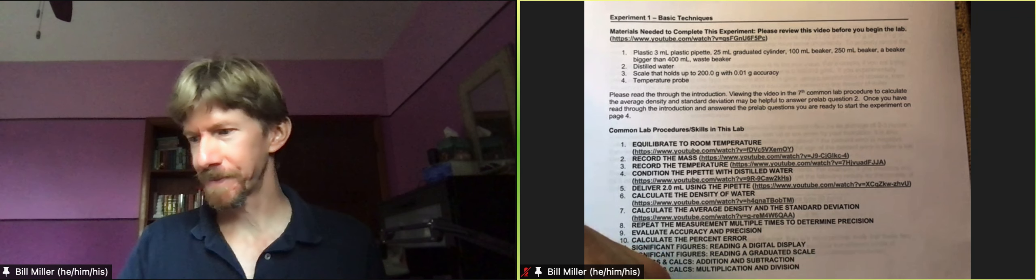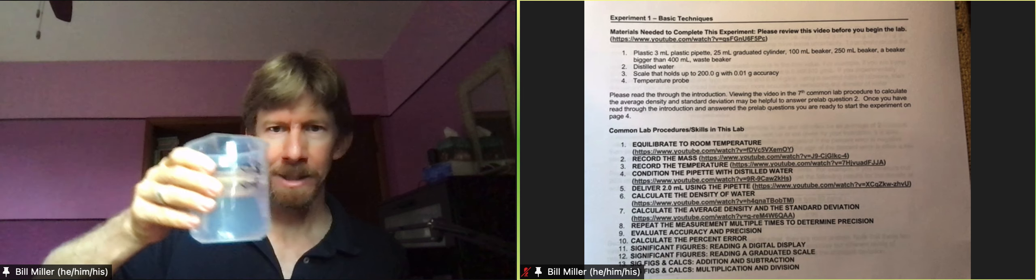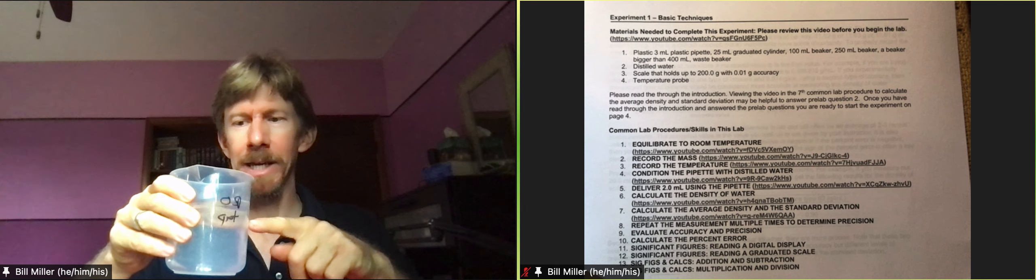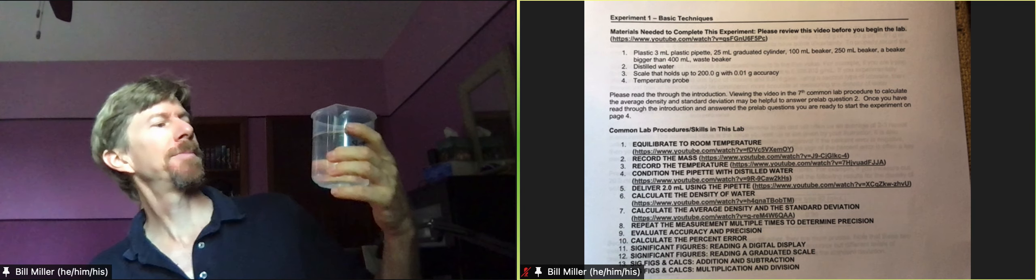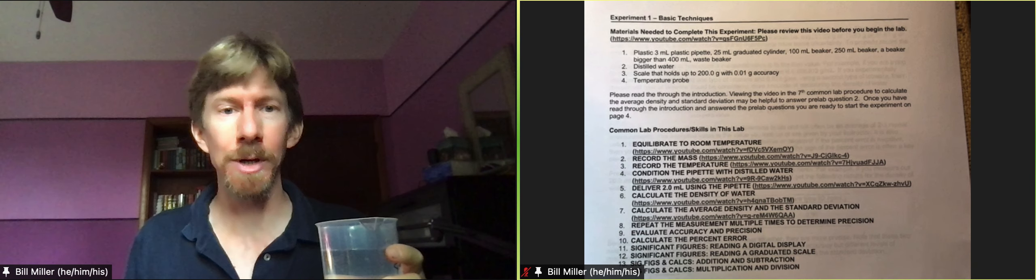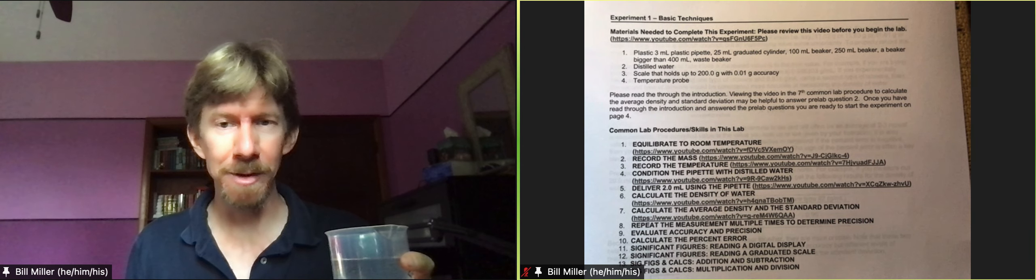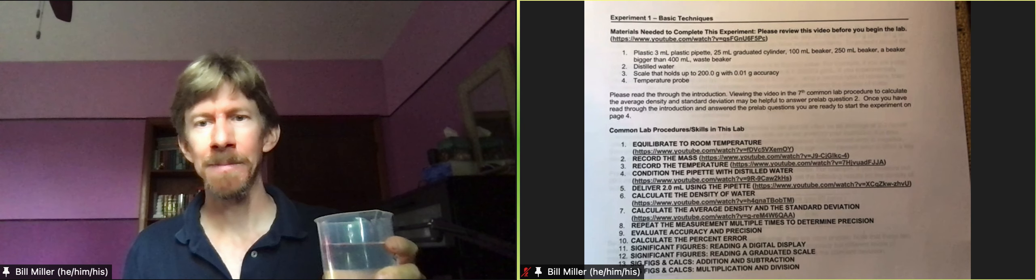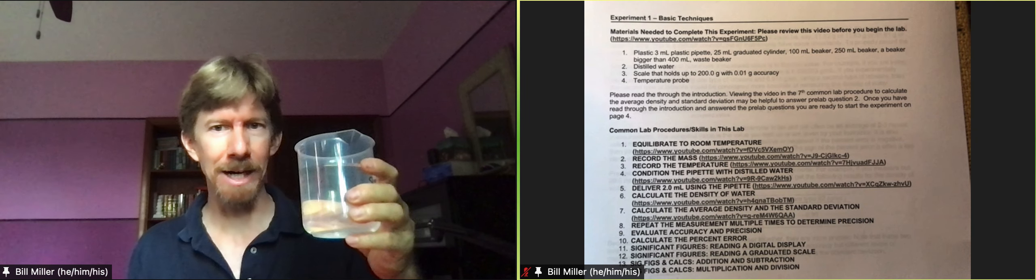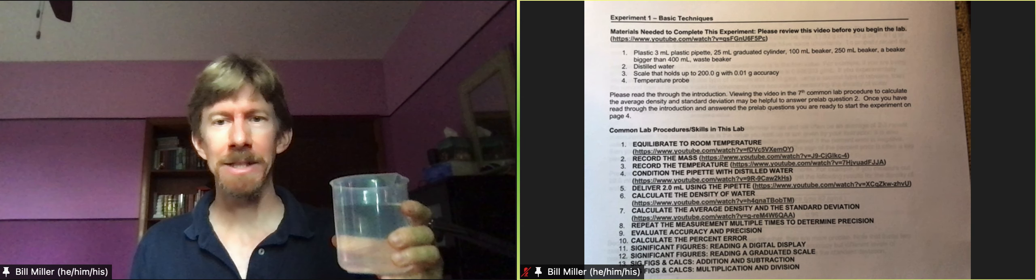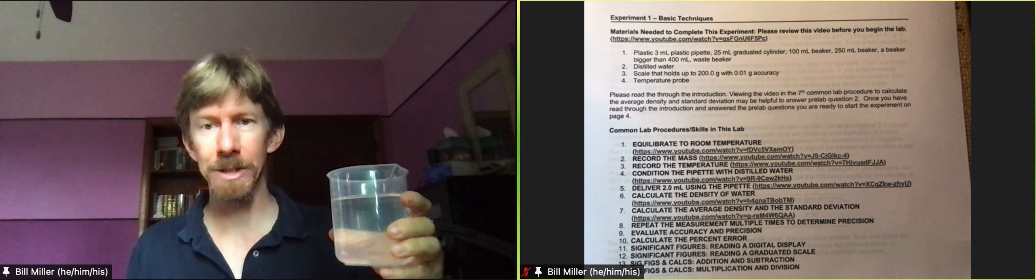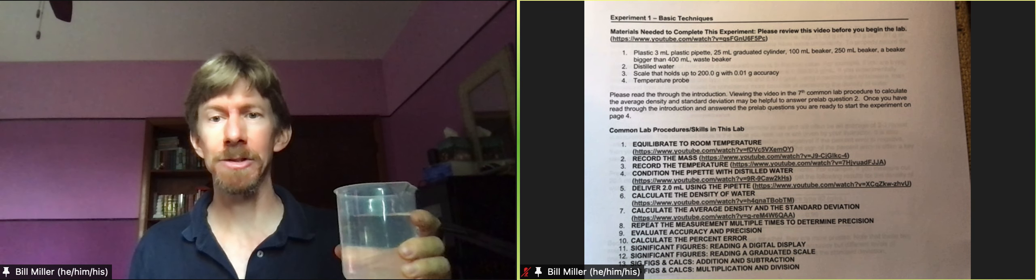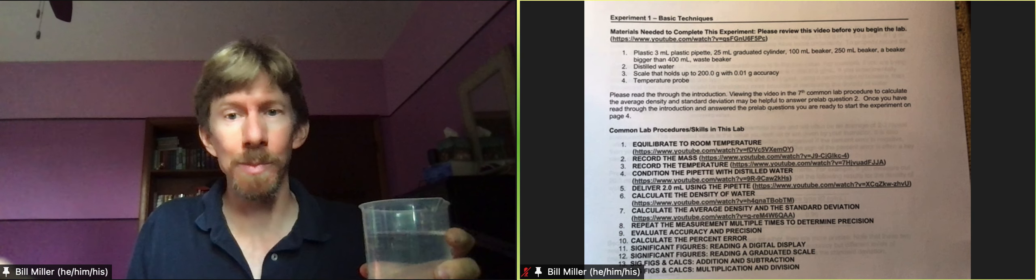I've also got my water and what you want to do before you start this experiment is get about 400 milliliters of water. I have about 360 or so. When it says get 400 milliliters of water it means very approximately, 500 is still fine, 300 is still fine for this experiment. You're not really measuring it, you're just getting a lot. One of the things we'll learn from this experiment is that beakers are good for holding solutions, they are not necessarily good at being able to measure solutions accurately.